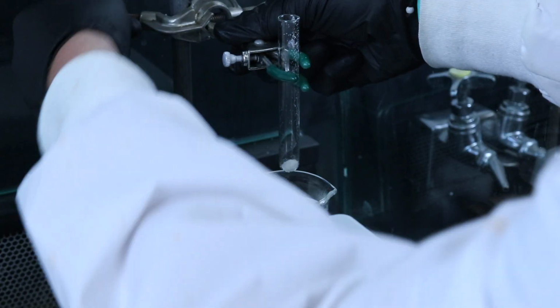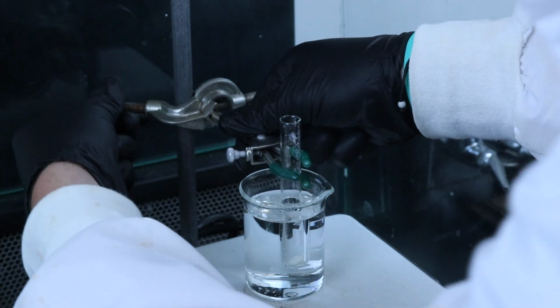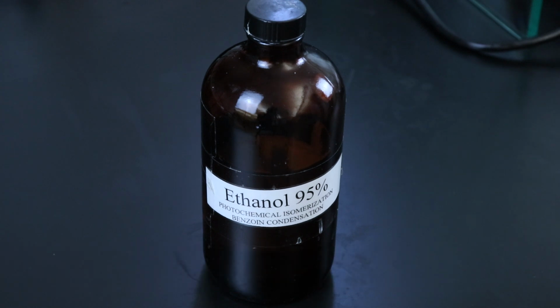Once the product is in there though, you can place the test tube or the Craig tube into the hot water bath and start getting the solvent that you'll be using to dissolve the solid. In this example, I'll be following the procedure and using 95% ethanol as the recrystallization solvent. And you can do the same. You should follow the procedure in any given lab, dissolving the solid product in whatever solvent it recommends.